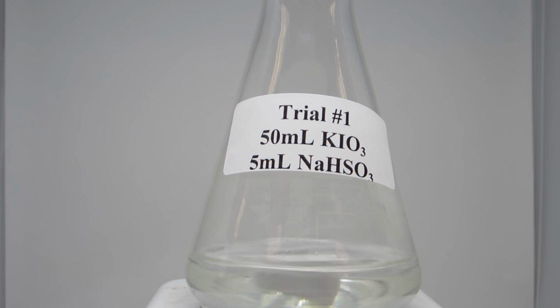In this experiment, you will be reacting potassium iodate with sodium bisulfite at varying concentrations of iodate ion. As we decrease the concentration of potassium iodate, you will notice a change in the reaction time and can determine the rate of the reaction relative to the concentration. You will be looking at whether, based on the concentration, the iodate ion is a first order or a second order determining factor for the rate.